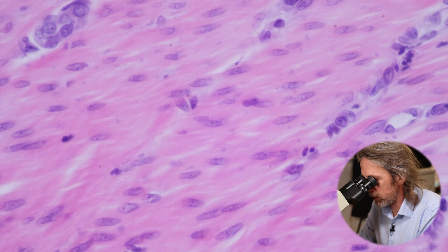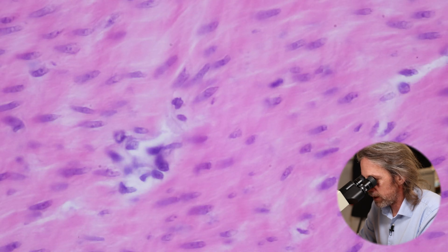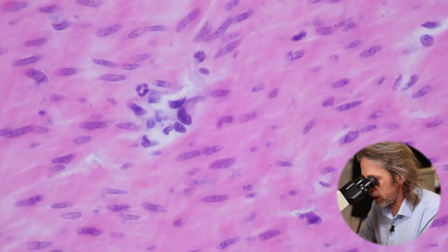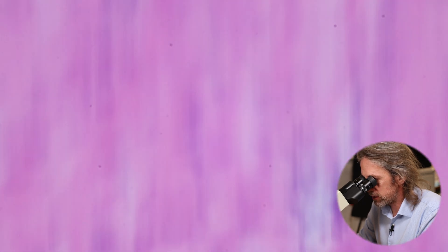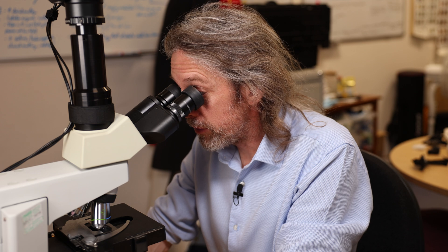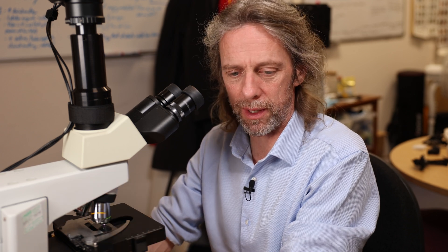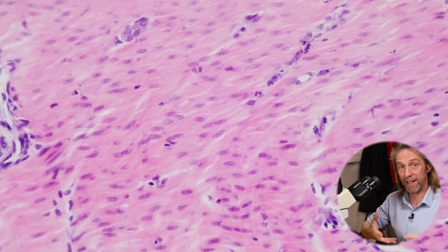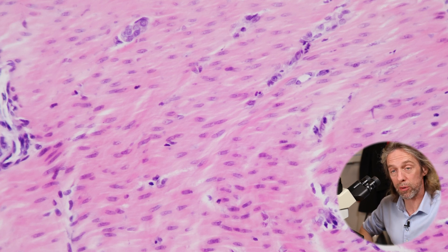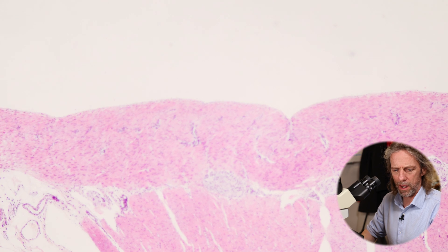In longitudinal section we can get a sense of some of the myosin filaments. Around the smooth muscle there's connective tissue, blood vessels, lymphatics, and nervous tissue - smooth muscle needs a good blood supply and innervation just like skeletal and cardiac muscle. Another interesting property: some smooth muscle cells can spontaneously depolarize, similar to how the sinoatrial node works in the heart, and can trigger contractions without external stimulation.